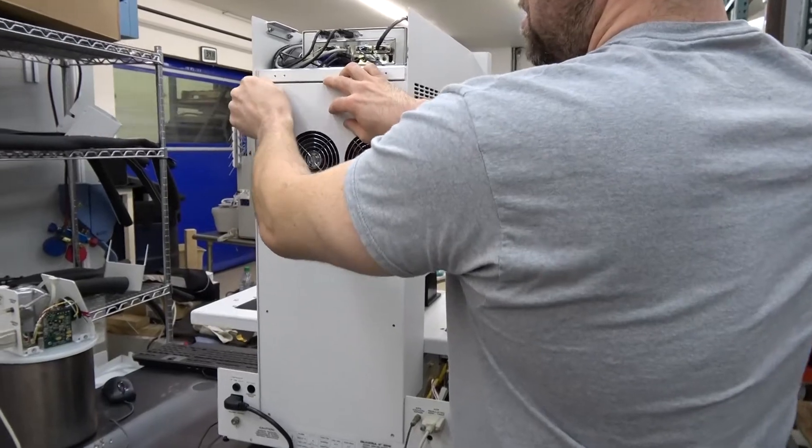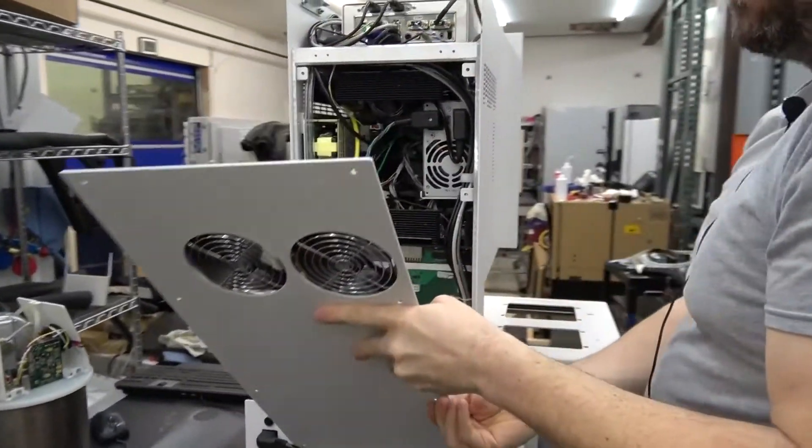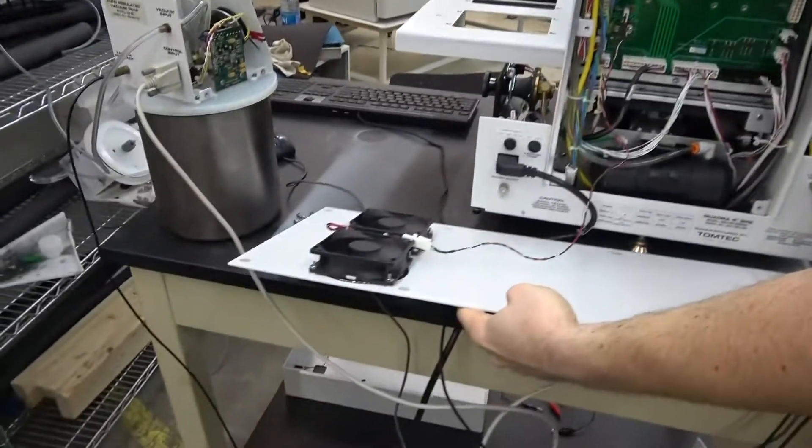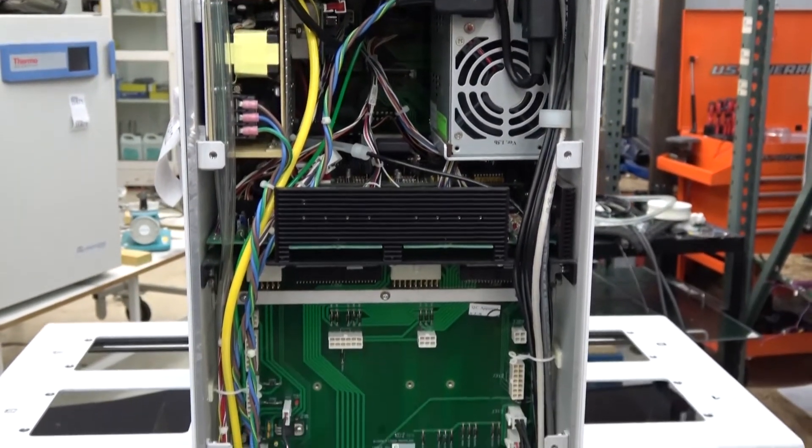With the back panel off, underneath you have your cooling fans, the electronics, and lots of boards. It has a built-in computer that's in there.